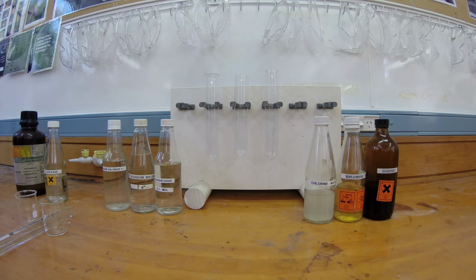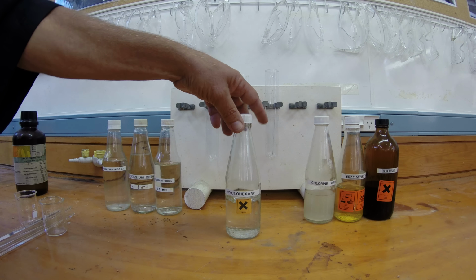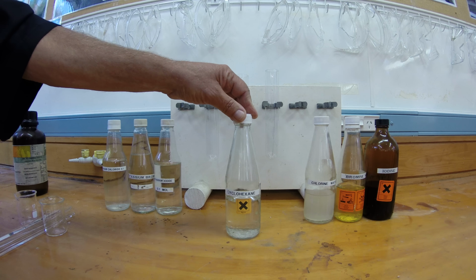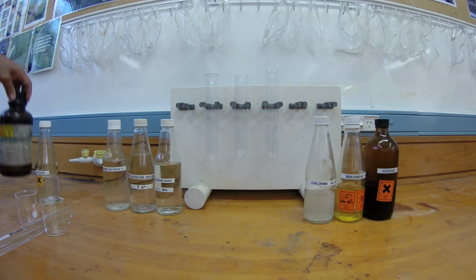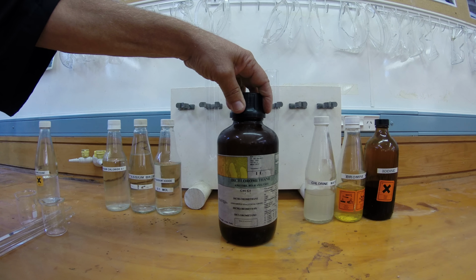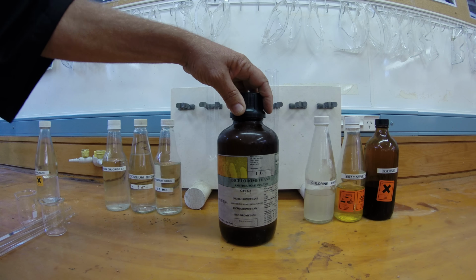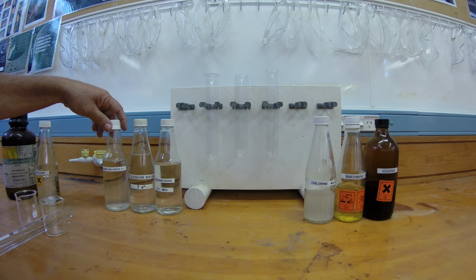All right, so we're going to repeat those on a larger scale here, and I'm going to use first of all this solution, this liquid, which is cyclohexane, to show you how it affects the products. Then I'm going to add in this one here, which is dichloromethane, and we're going to see if we can create a triple layer situation, which will be interesting in its own right.